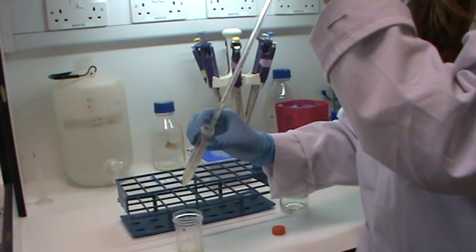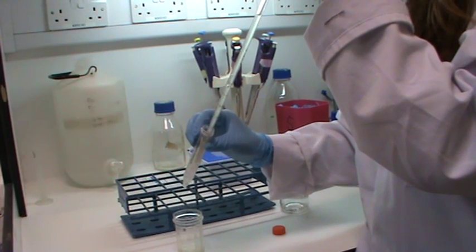I am now using a pipette to remove the liquid part. This is called the supernatant.